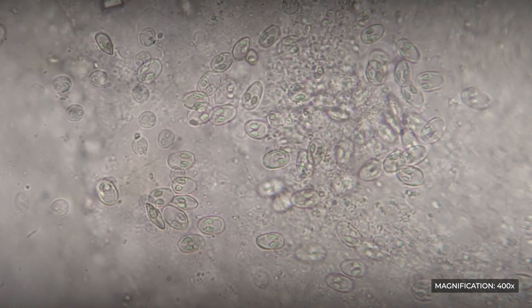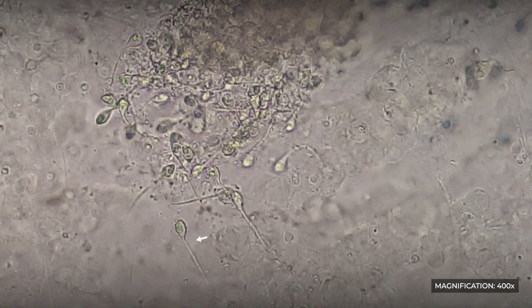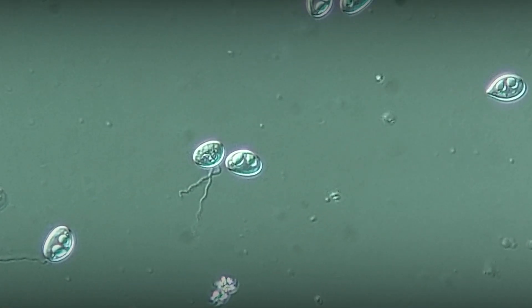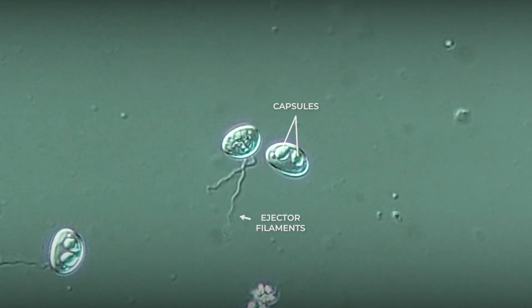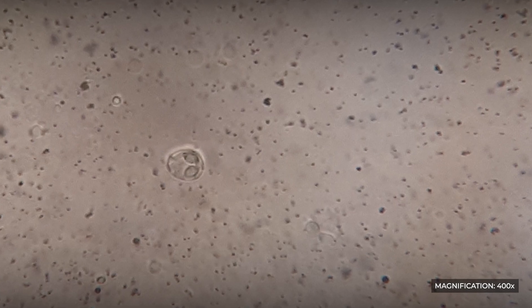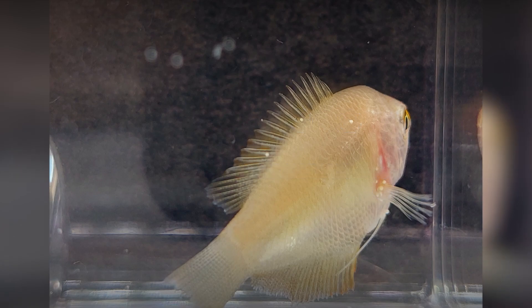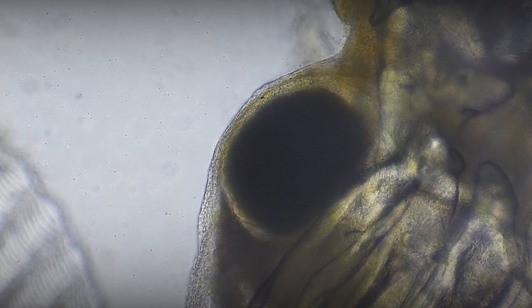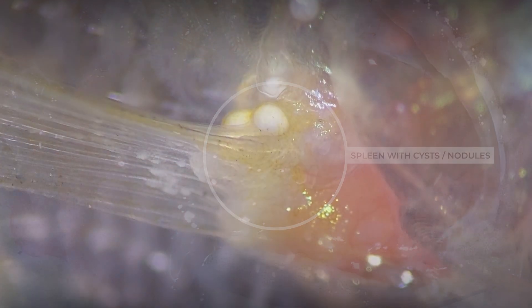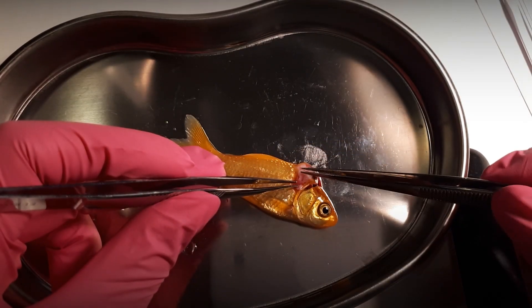Spores of different species have different shapes and structures. They can be round, oval, drop or heart-shaped, elongated, with spines or without. But what unites them all is the presence of two polar capsules containing ejector filaments. The detection of even only one spore in a smear confirms the diagnosis of myxosporidiosis. Parasites form cysts in various tissues and organs of the fish, where they develop and produce spores released into the environment. In infected tissues, we can observe nodules or granulomas, white spots, tumors, sometimes with exudate containing spores.